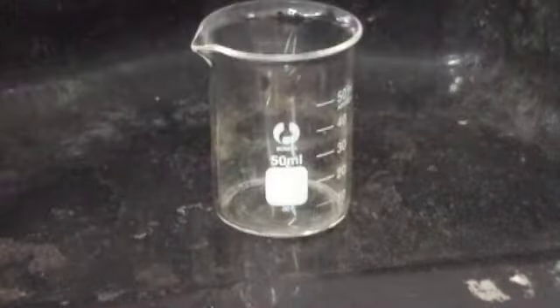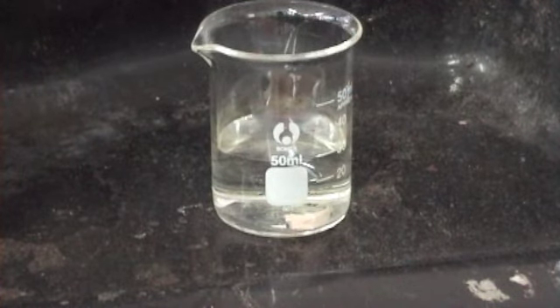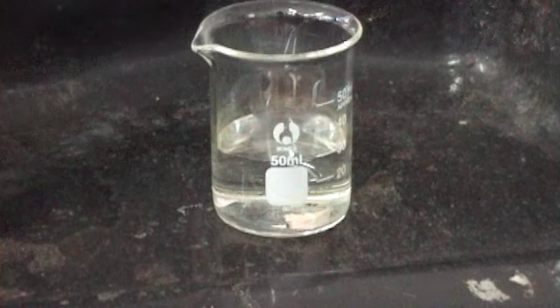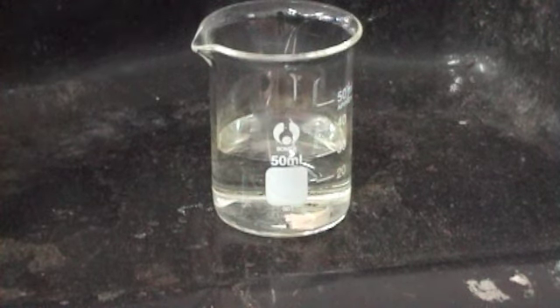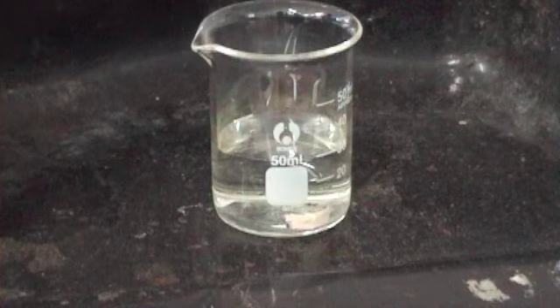Alright, so I'll take my little beaker away, get a new one out, a new sample of unidentified solution A. We know what it is, but never mind. Okay, this time we're going to add... No. In order to eliminate which ion? The other one. Barium, yes.